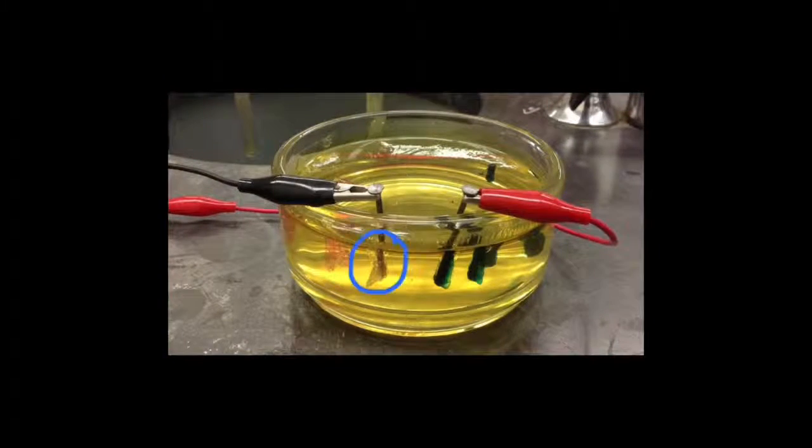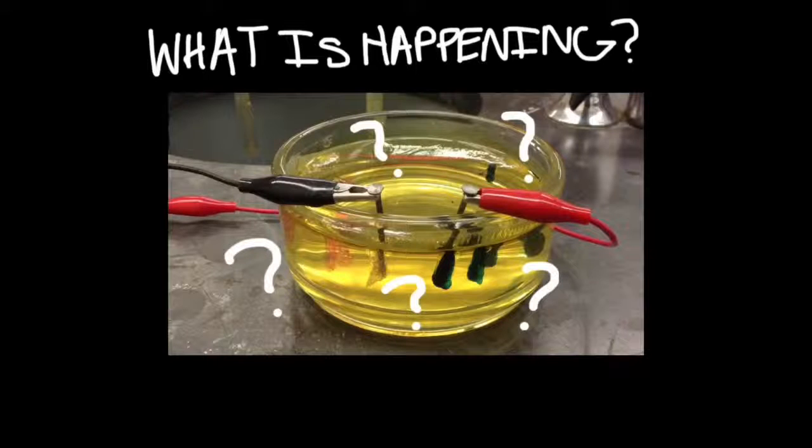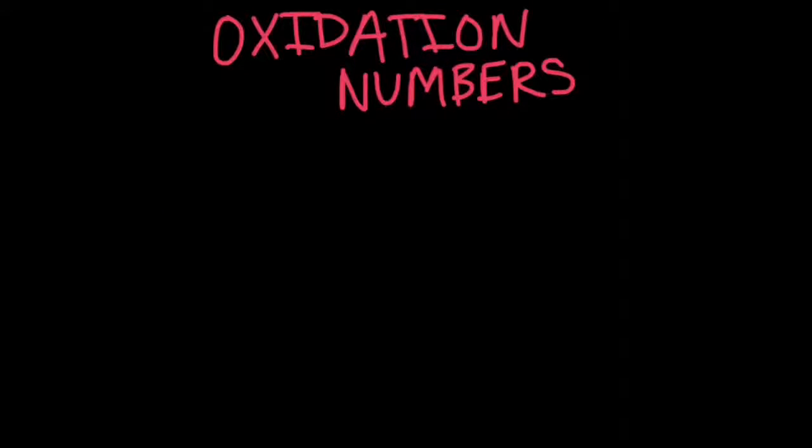Also note the bubbles forming around the pink color. Now let's figure out what's actually going on here. First, let's look at the oxidation numbers of the two half reactions.